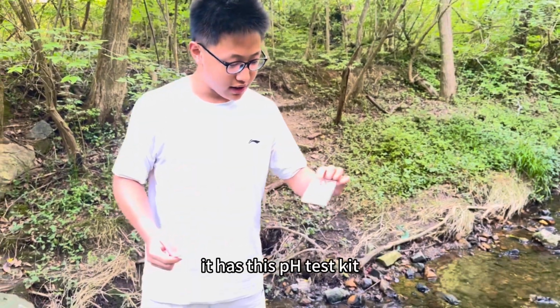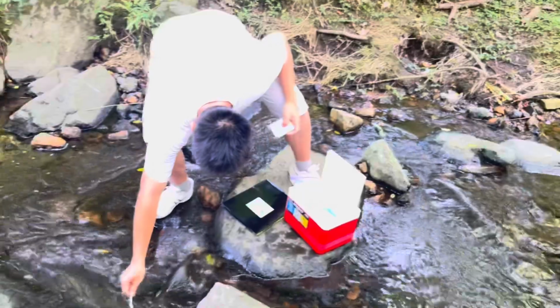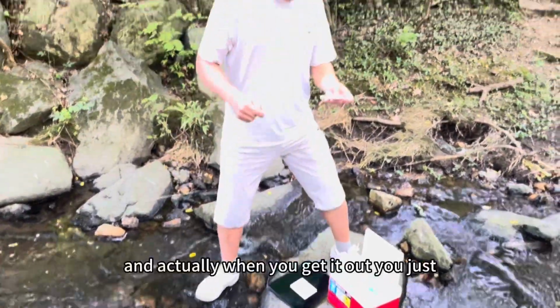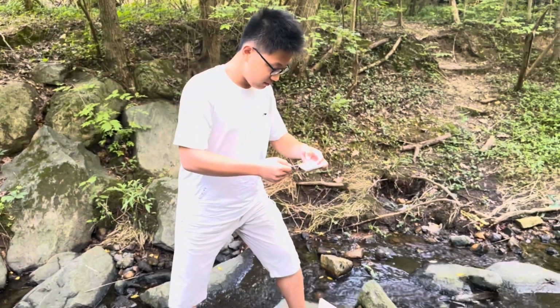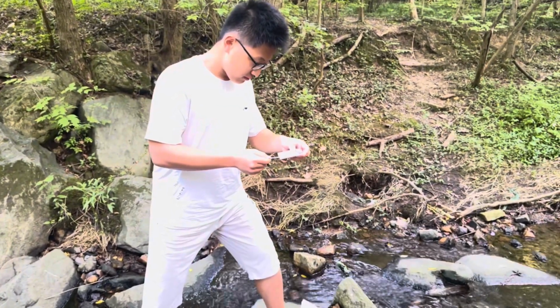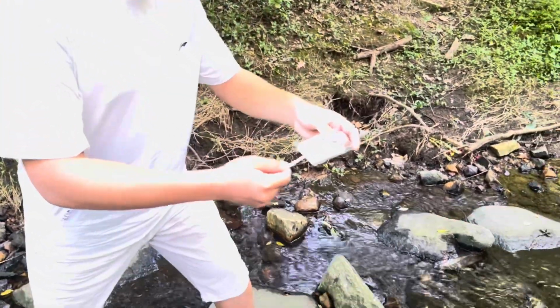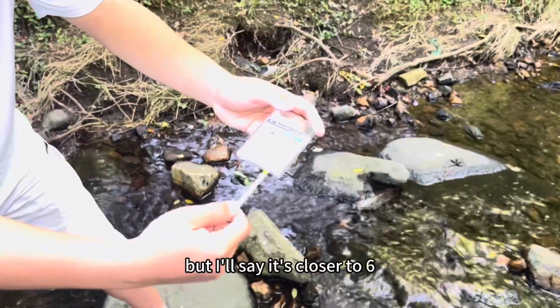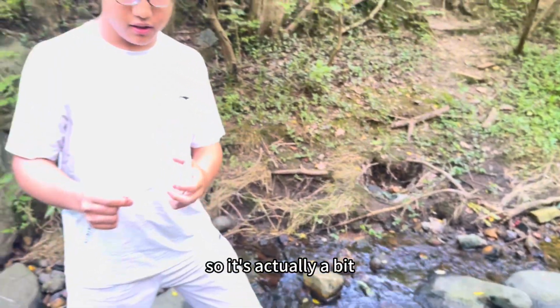It's really simple. It has this pH test kit. When you get it out, you just match it. This is kind of like a 6.5, but I'll say it's closer to 6. So it's a bit acidic.